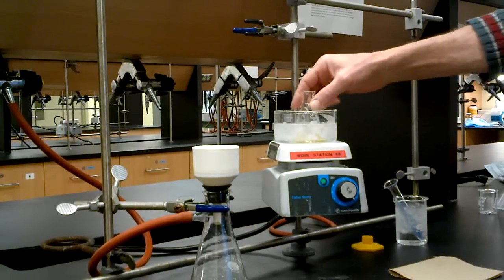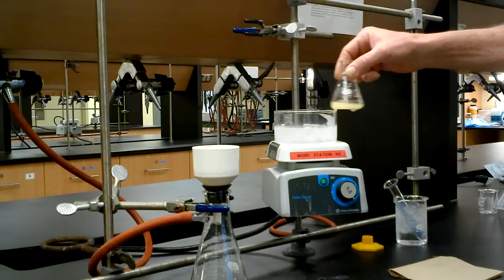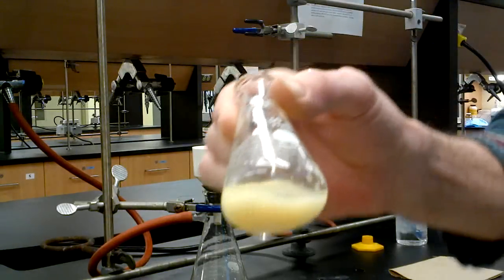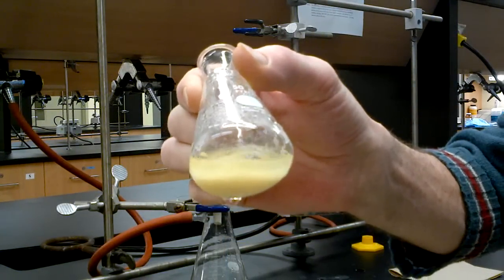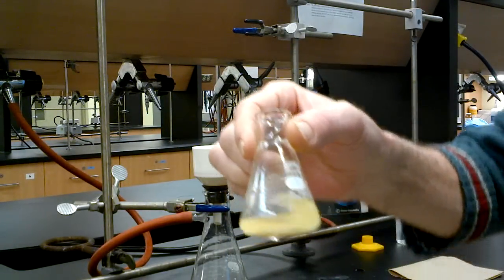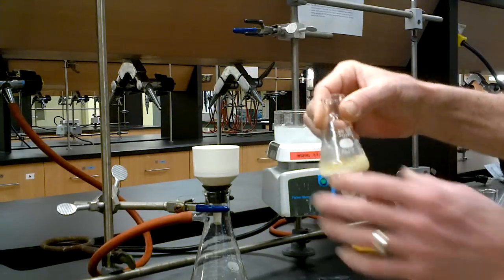Okay, here we are, 15, 20 minutes later. Everything has come out of solution quite nicely. And you have to give compounds time to crystallize. So be patient, and you'll get a better yield.